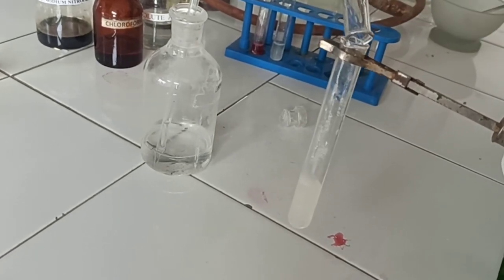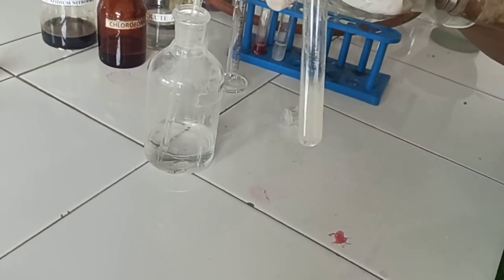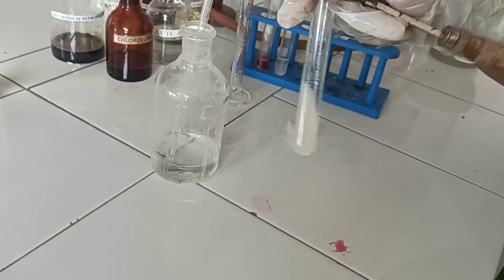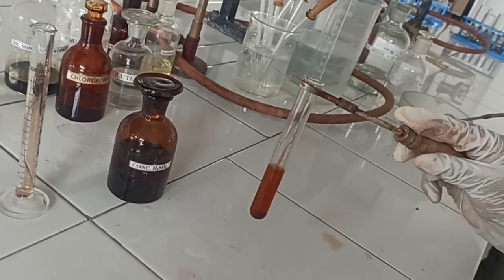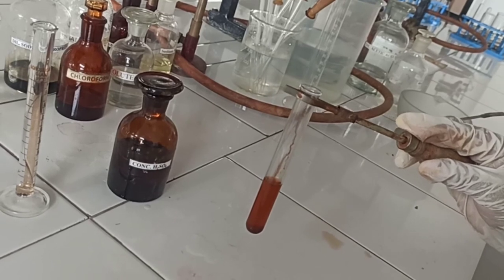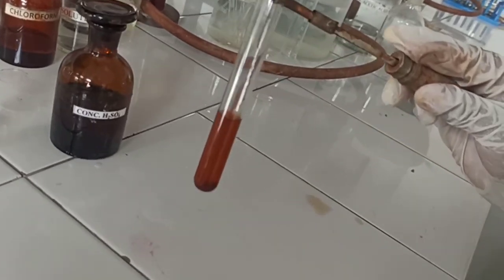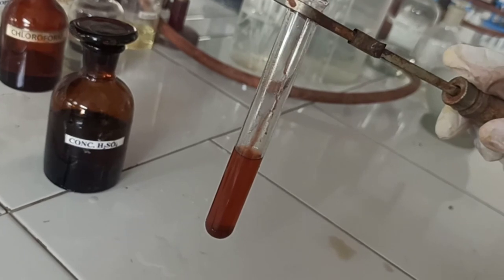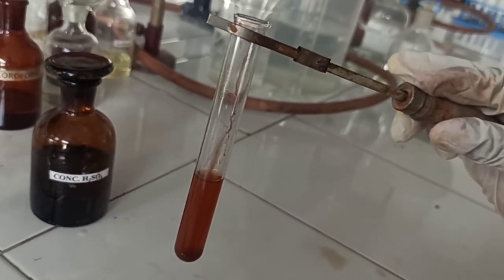Then shake with 3 portions, each 3 ml of solvent ether, and then we have to add to the aqueous solution 2 ml of bromine water. So after adding bromine solution, we warm it on a water bath and then we add 10 mg of resorcinol in 3 ml sulfuric acid. We get this color which is not a bluish black color. So this test does not comply the test for IP for our drug prochlorperazine maleate.